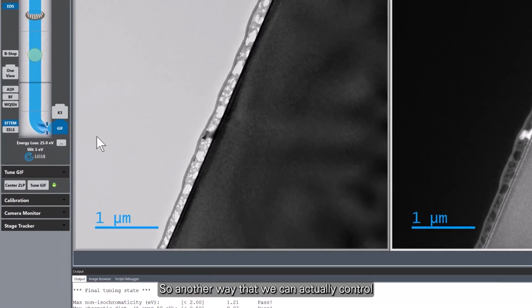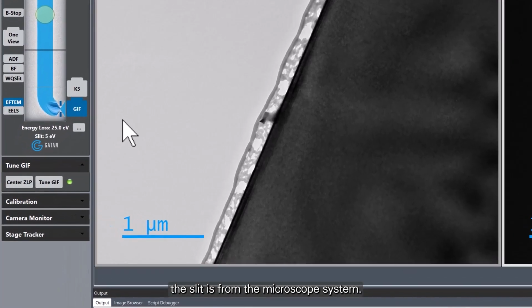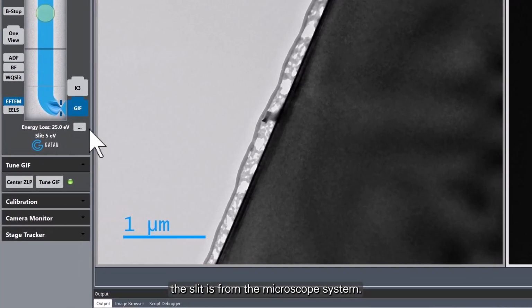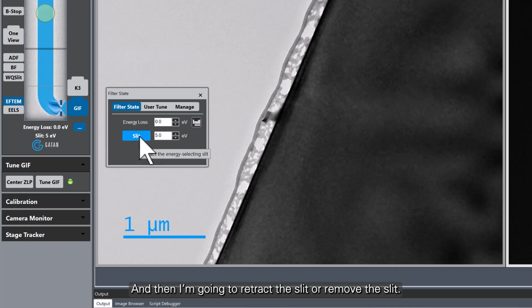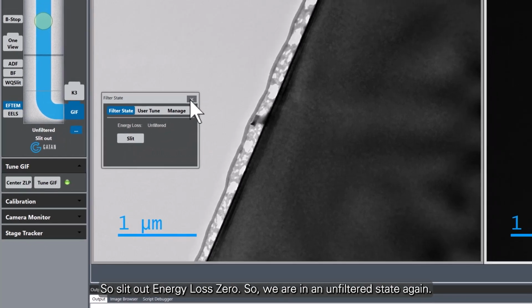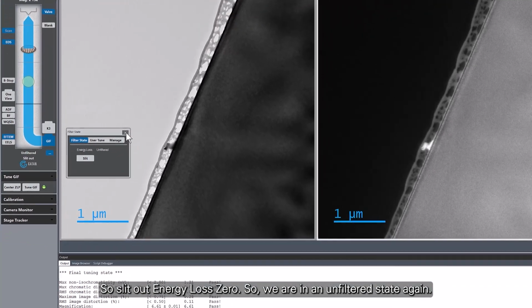Another way that we can actually control the slit is from the microscope system. If we go over here into the microscope UI, you see that there's this little button with 3 dots. If I left click on this button, now it's possible for me to go back. So I'm going to manually change the energy loss to 0, and then retract the slit or remove the slit. So slit out, energy loss 0. So we're at unfiltered state again.